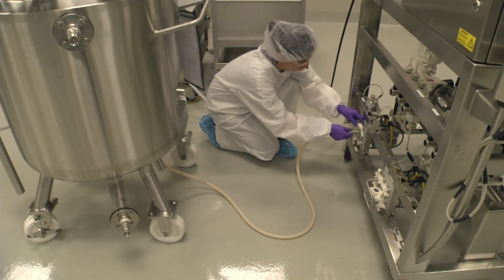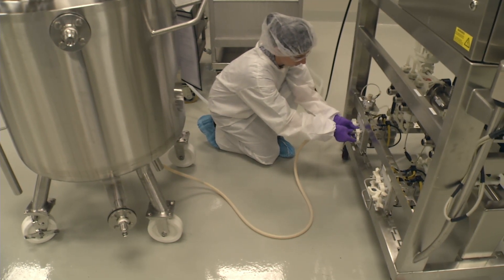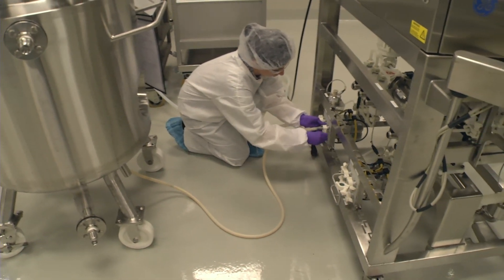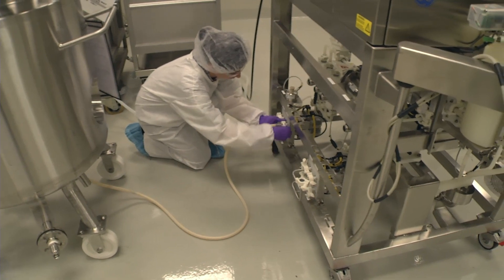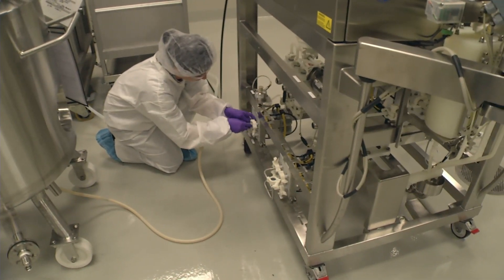The purification process begins as the transfer tank of clarified lysate from the recovery process is connected to the inlet pump on the chromatography skid.